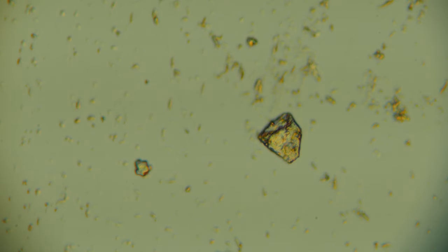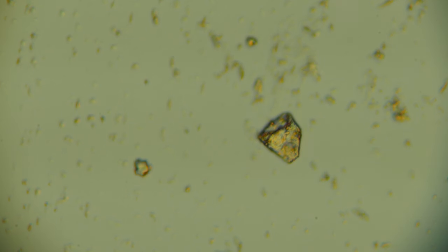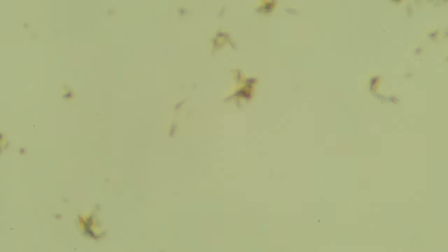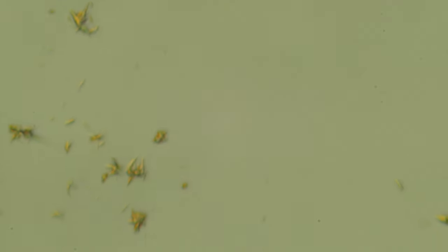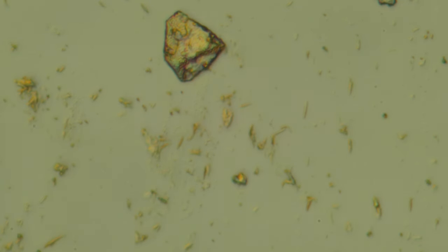So here's the 40x DIC with the correct 40x prism below, and we can see different layers of it pretty clearly. But then when I put the projection eyepiece into the trinocular head, like that, I think it's clear what I'm doing because the camera's falling all over the place. Then, where did we go? Jiggled our way to our cell there, unless it's a little bit deeper, higher up. There it is.